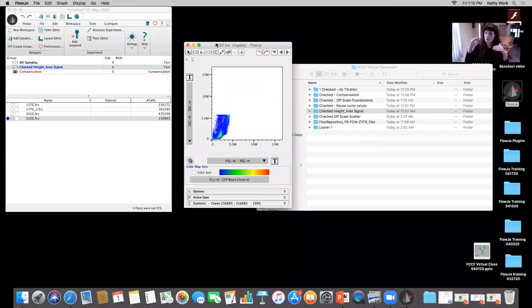We see the full range of the forward and side scatter, and in linear, any detector is now going to be at 16,777,216. So just a nice little reminder.